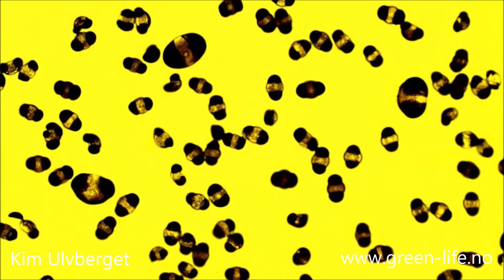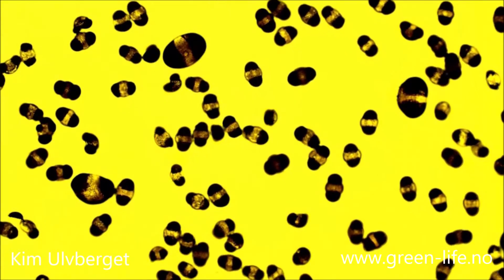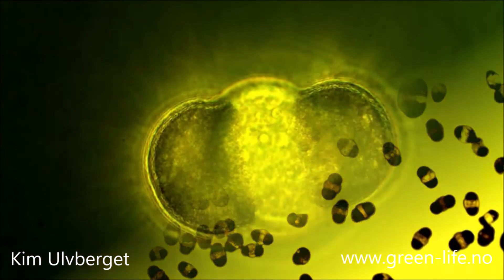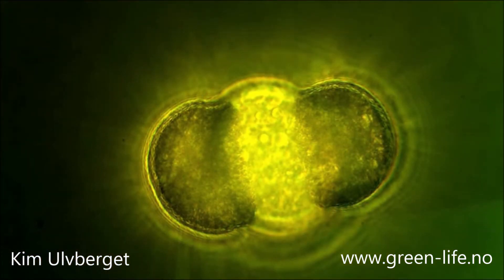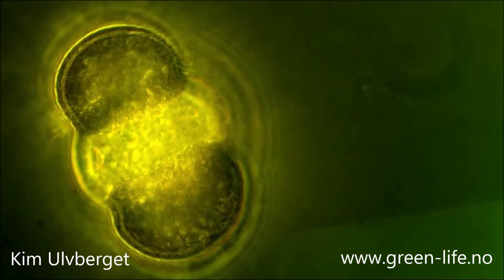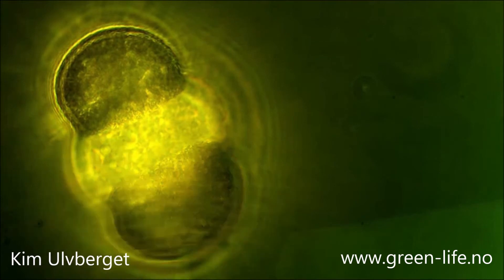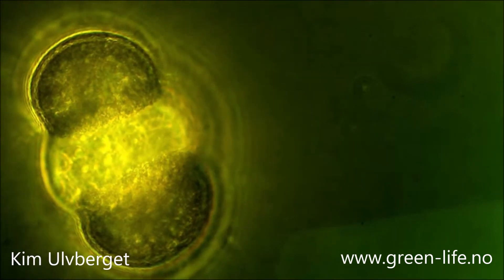When the female plant is fertilized by the pollen, they produce a seed or a fruit which are basically their offspring. This video is recorded through our phase contrast microscope.